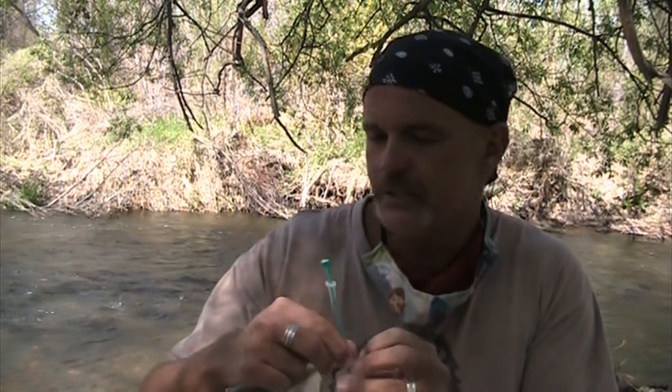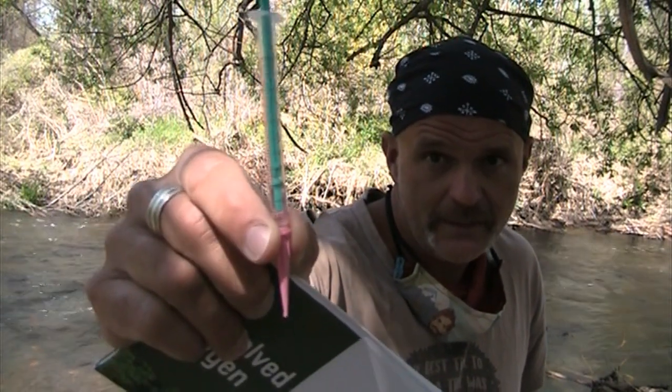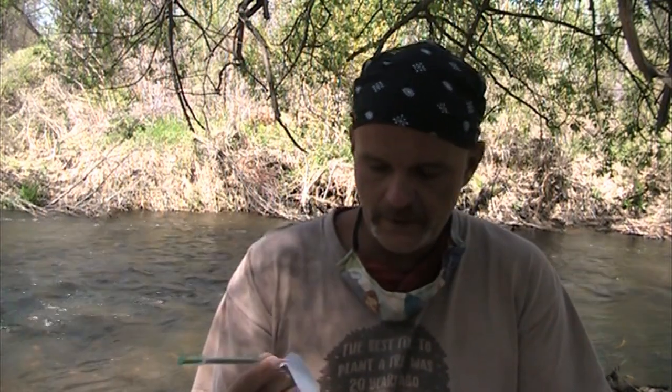You're going to take the syringe, and you're going to tell your students, do not empty the syringe. If you're a student, do not empty the syringe, because we still need to add more. In this case, I've added 8. What that means is there's at least 8 units of oxygen per unit of water. And the units are in, I believe, parts per million. They are in parts per million because I read the directions.